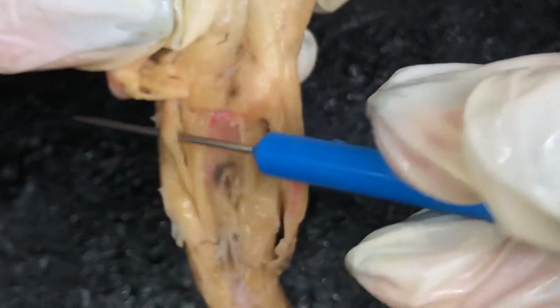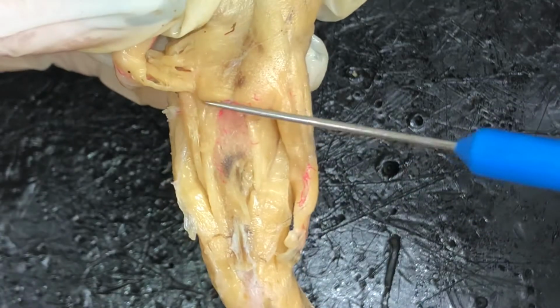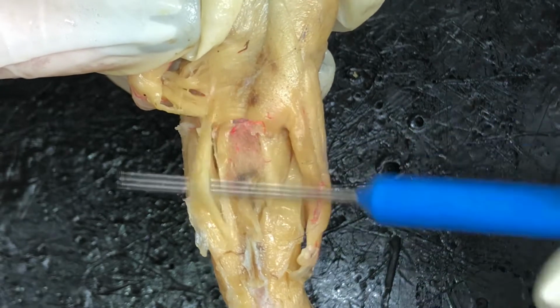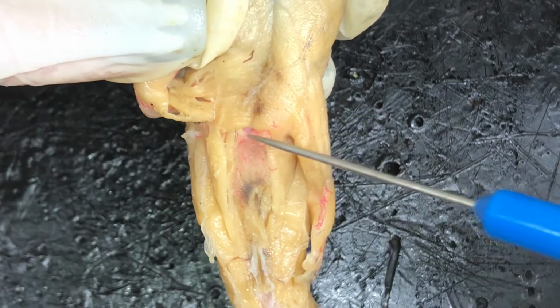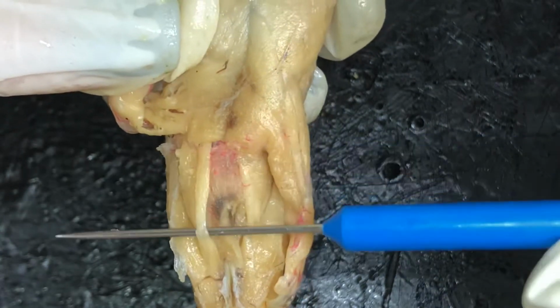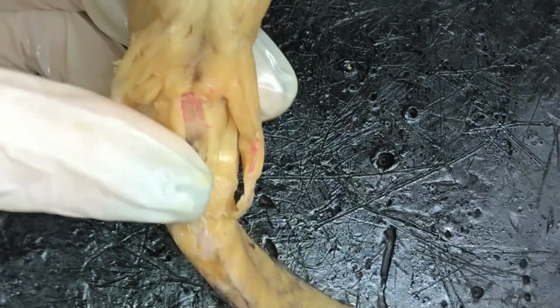That muscle that I was picking up earlier is in the center. It's called the caudocrucialis, right here. And then the most medial muscle is the ischiocaudalis, which is right here. That's the ischiocaudalis. And that is all of the muscles for the Necturus.